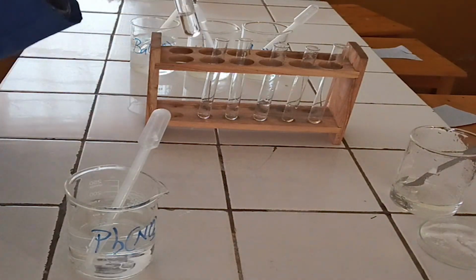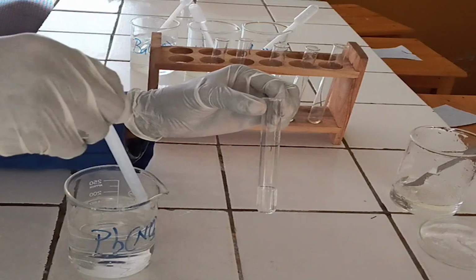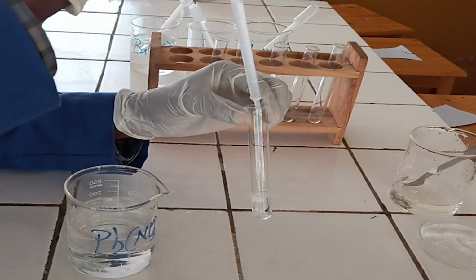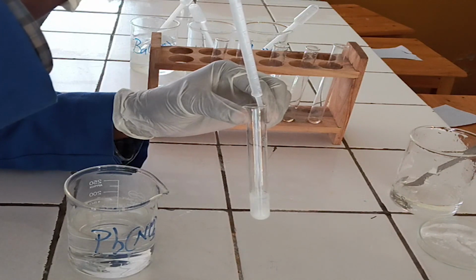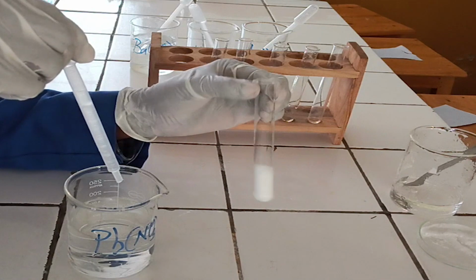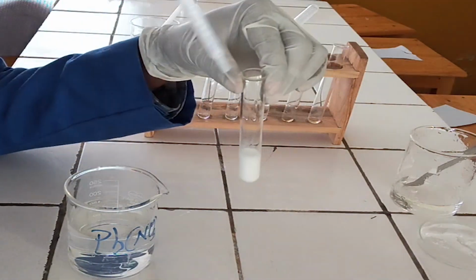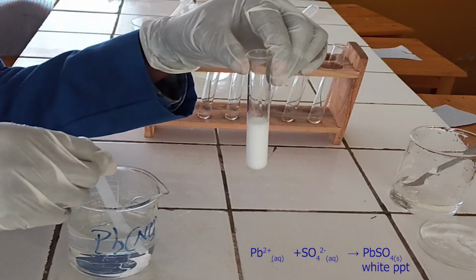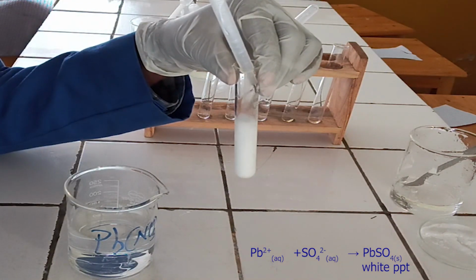To the first test tube, add lead nitrate solution. As you see, lead nitrate reacts with sulphate ion to form white precipitate. Below, there is the ionic equation for this reaction.